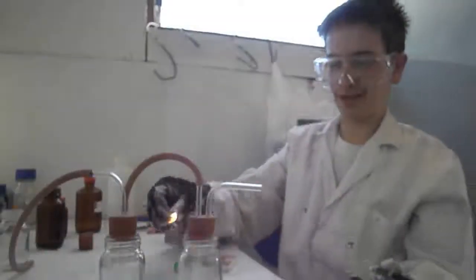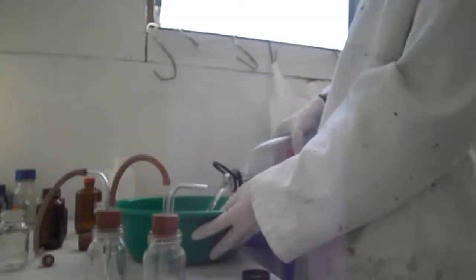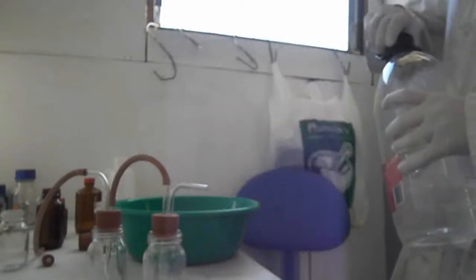Let's light a match, see if something blows up. No, nothing. Dag nabbit. Well, good thing I made a backup plan. I didn't make a backup plan. That's to a certain height, which should be good.